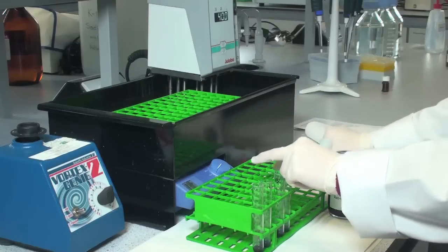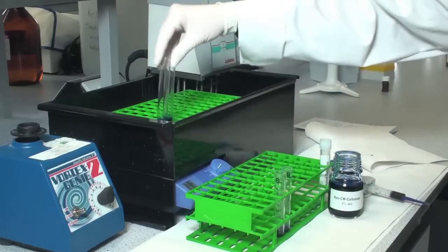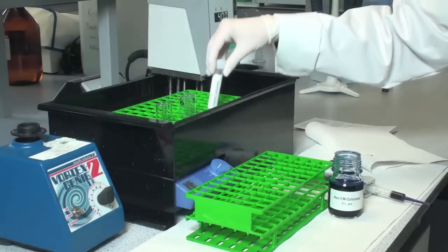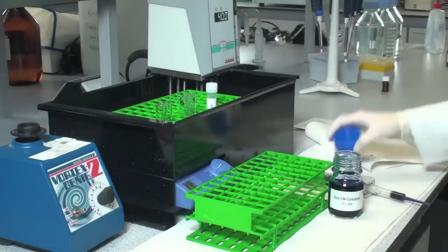Then place these 4 tubes plus the enzyme solution in a water bath of 40 degrees centigrade to allow them to pre-incubate for approximately 5 minutes.